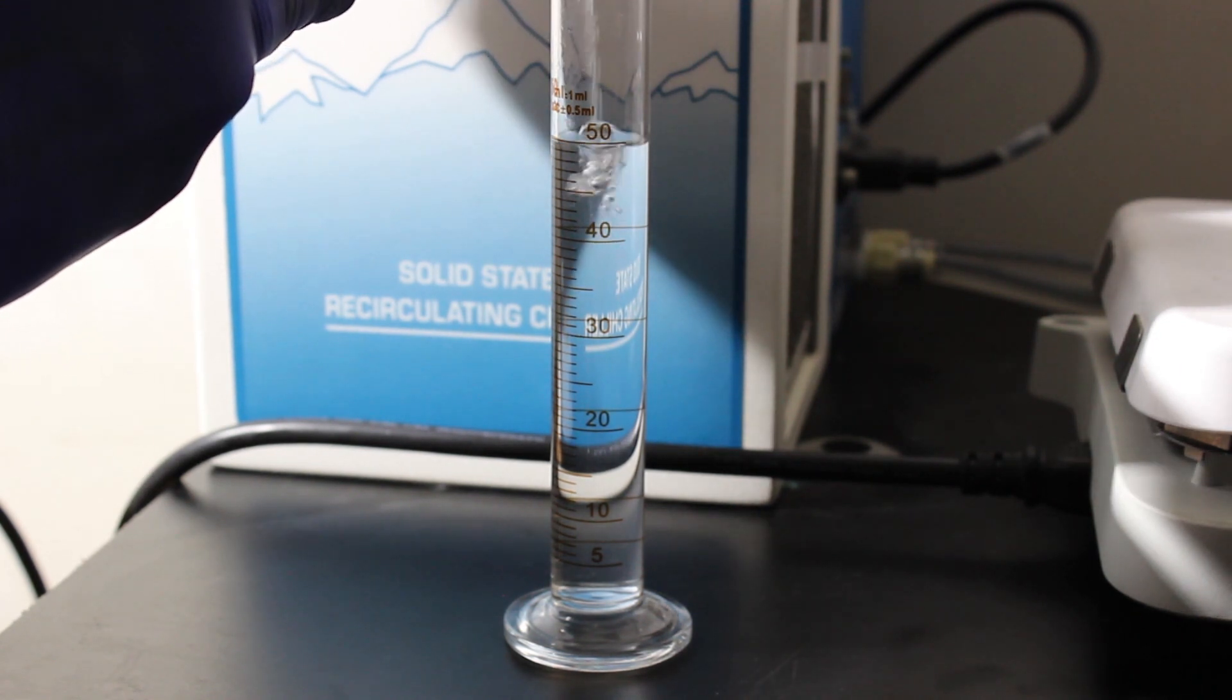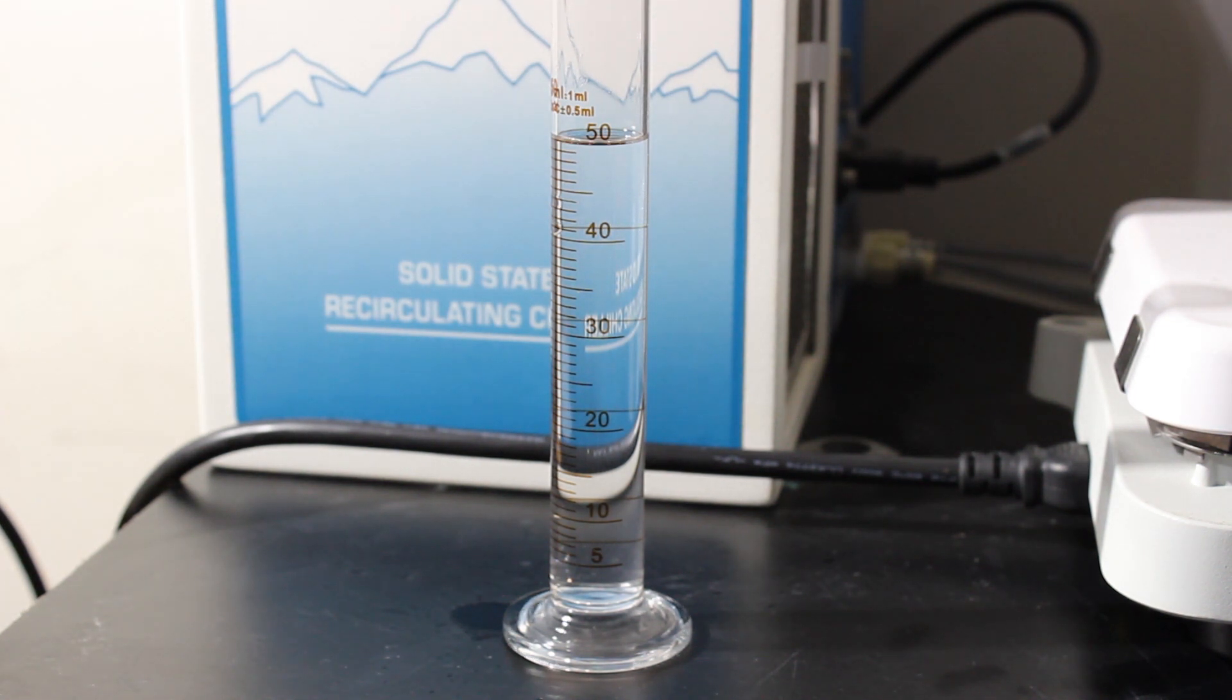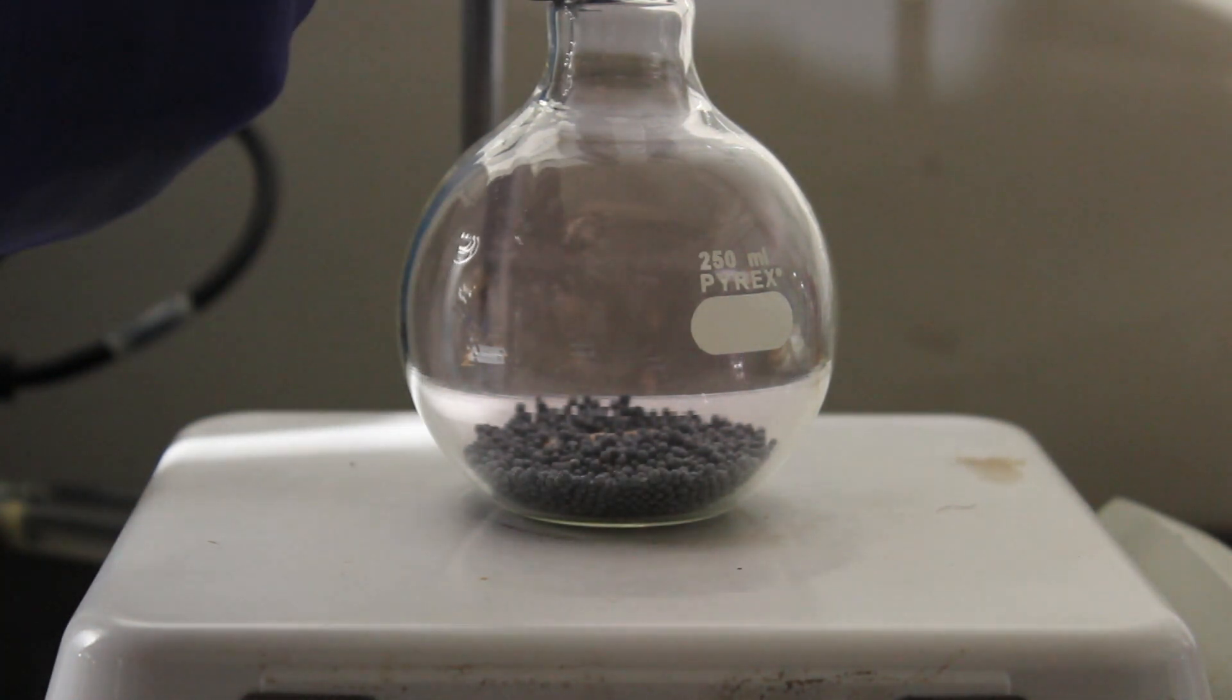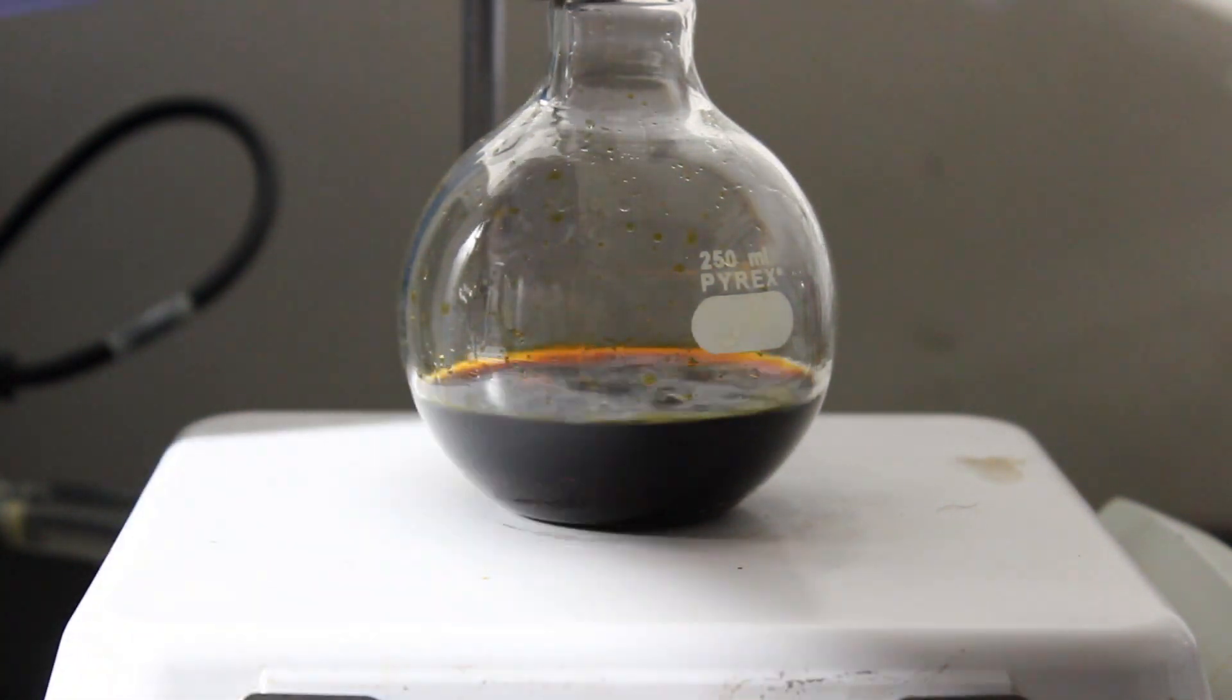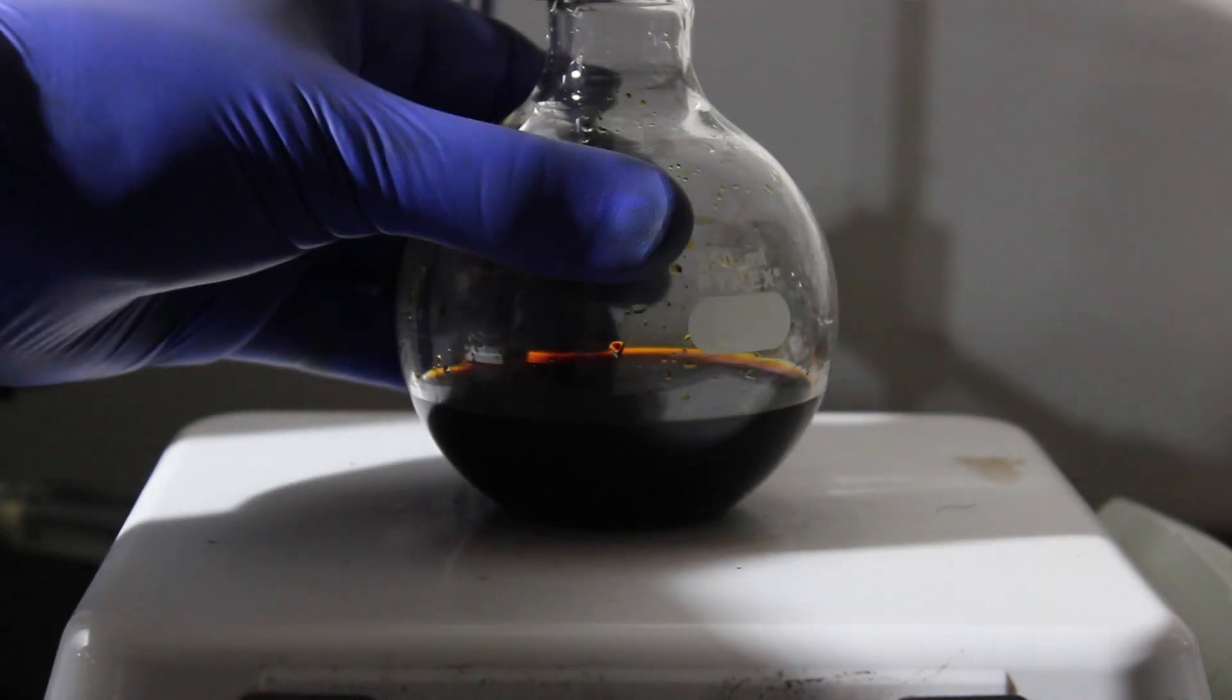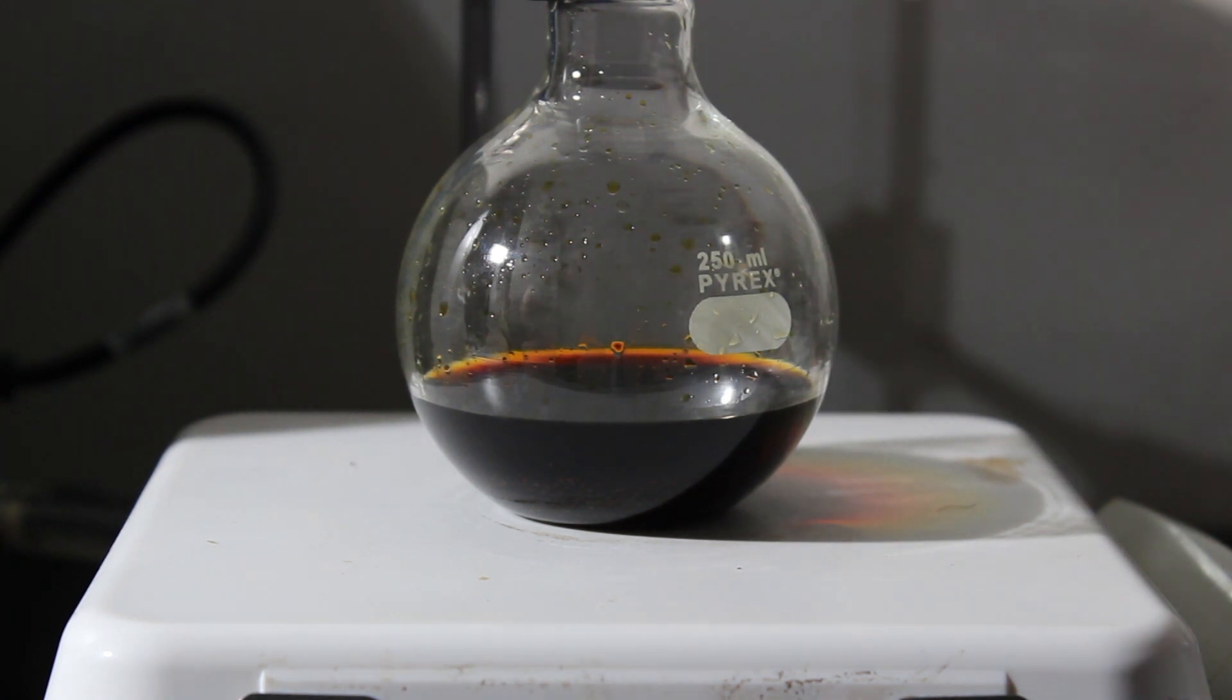A little more... nailed it, close enough. Add that to the iodine. As you can see, iodine goes into solution. I already have a stir bar in there, so once I add the aluminum foil we'll get that going and we should be ready to go.